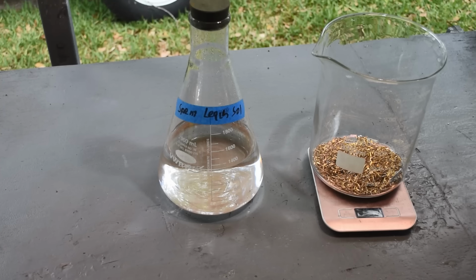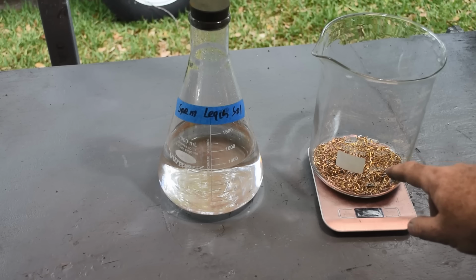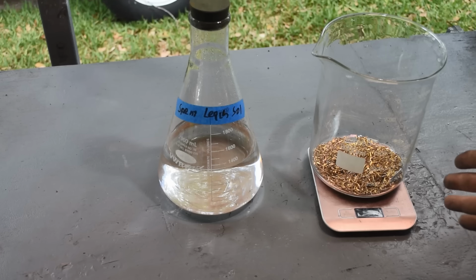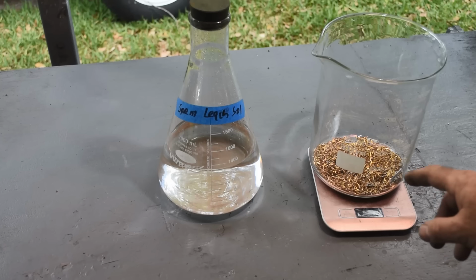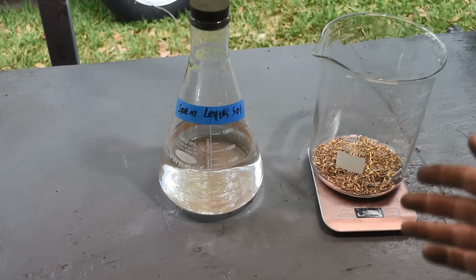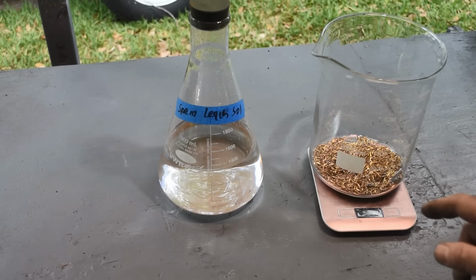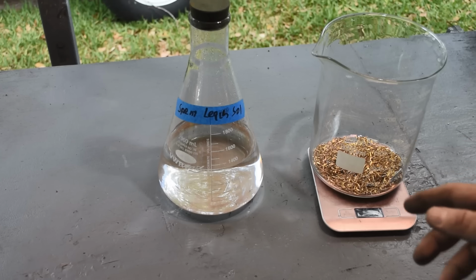But we're going to try regenerating this and see if it works with a whole lot of extra agitation, and another change I'm going to make is we're going to give this at least 2 treatments. So I'm going to mix up maybe close to 1 liter of the regenerated leach, and we'll put maybe 300 milliliters or so on these and agitate the heck out of it for a while, drain the stuff off, put another 300 milliliters on, agitate the heck out of it for a while, drain it off.